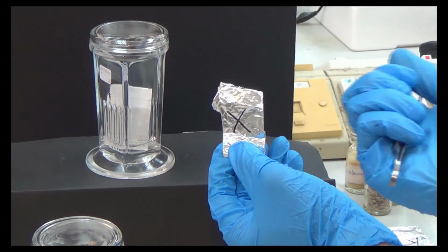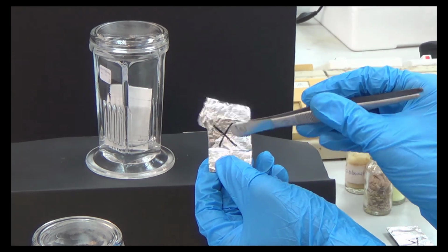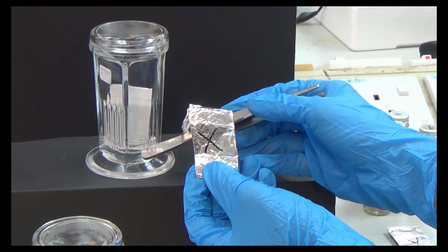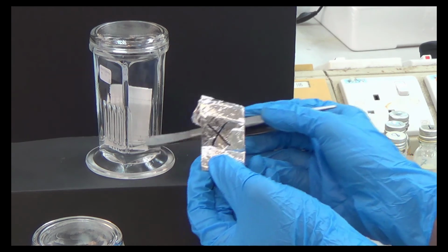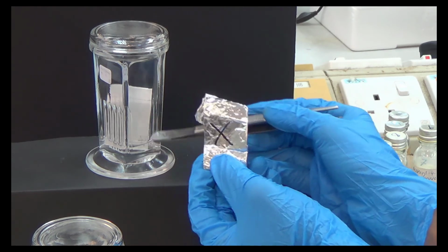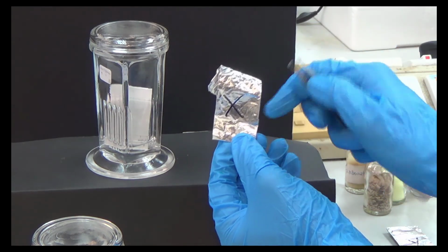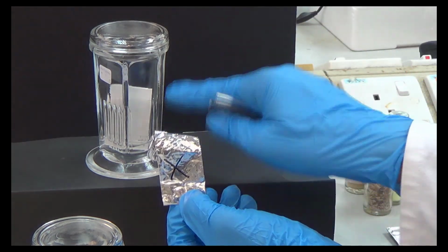So you need something to push. You need something stronger to push this compound off the silica gel. So you need to use maybe a different polar solvent. You need to play around with the polarity of your eluent or mobile phase, because different eluents or mobile phases have different capability to kick the compound. If the compound is very polar, you need something capable of pushing it so that you can see the separation.